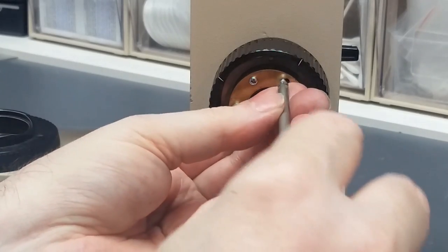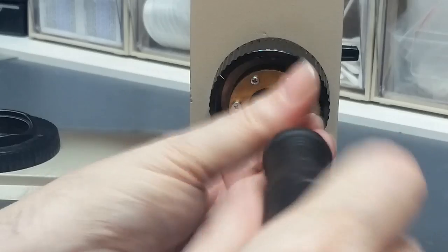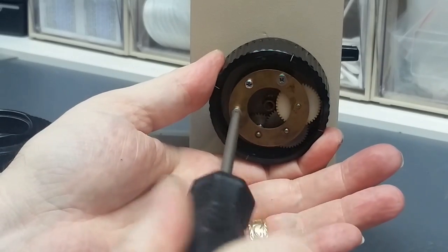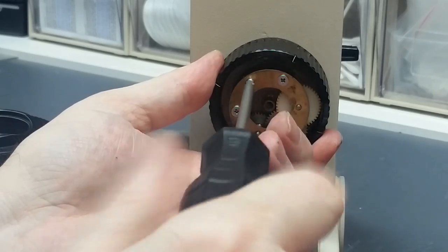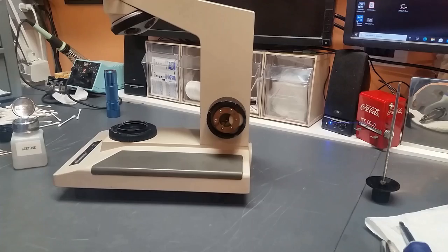And when they tighten down, that puts this ring in perfect alignment. So we tighten those down. Then go back and tighten the middle pan head screw. Okay, now this thing is ready to go.